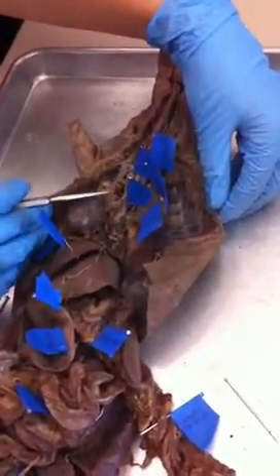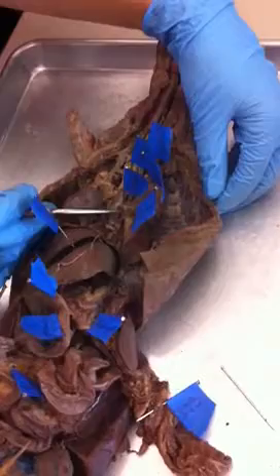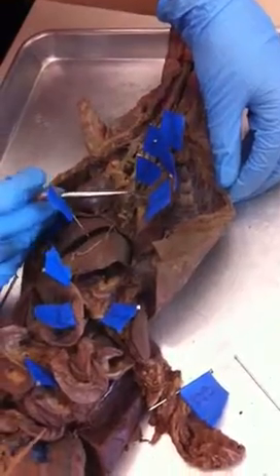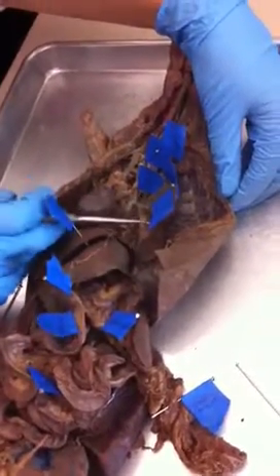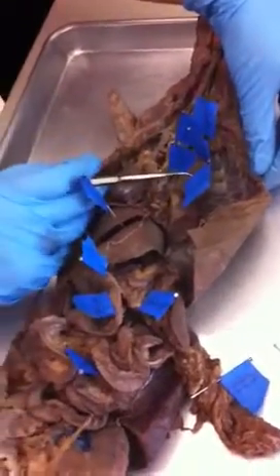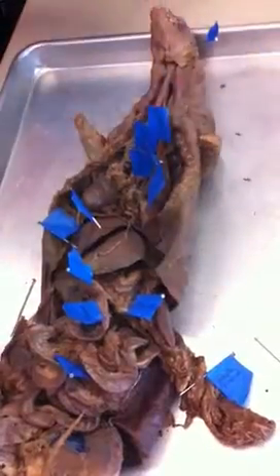So: trachea, primary, secondary, secondary. You can see the difference, right? Finally, reach the lung. That's the respiratory system.